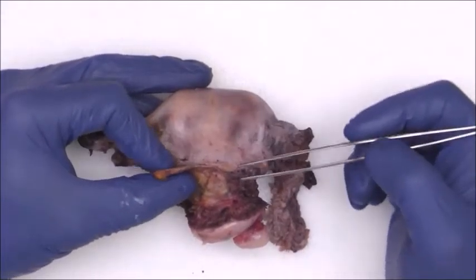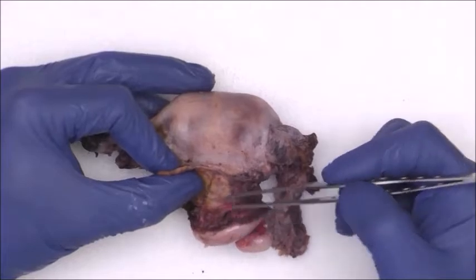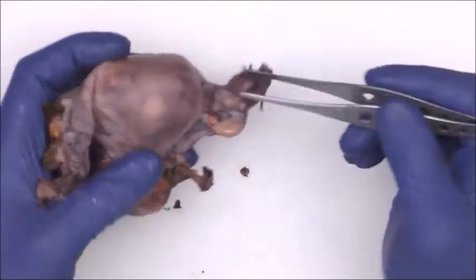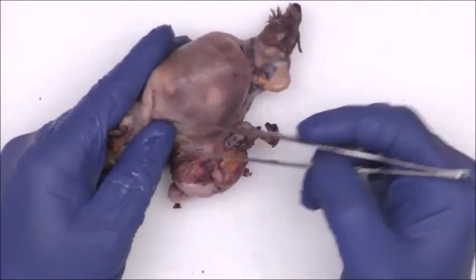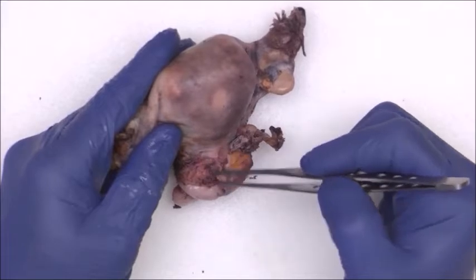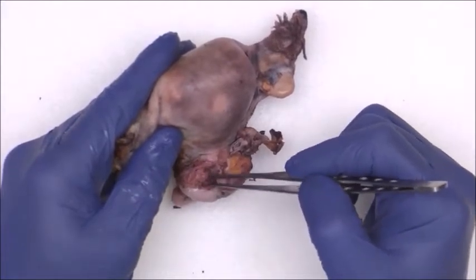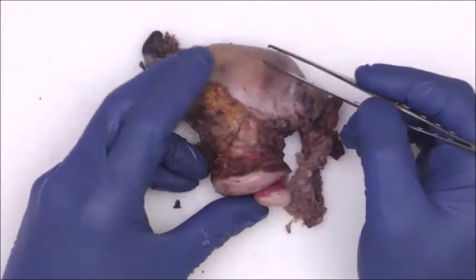We've got the anterior aspect, and we know this is the anterior side because where the serosa ends and the ectocervical mucosa begins, there's quite a distance here, as opposed to this side, which is the posterior side. We've got a lot of serosa here, and the distance from where the serosa ends and where the ectocervical mucosa begins is much shorter. So note this is the posterior side. This is the anterior side.